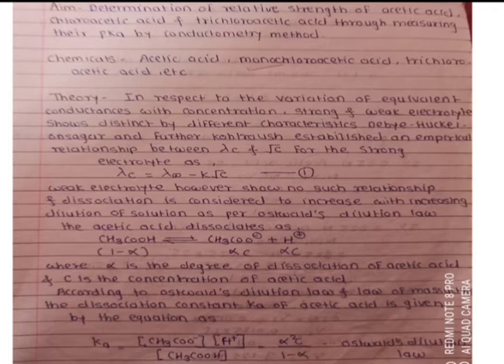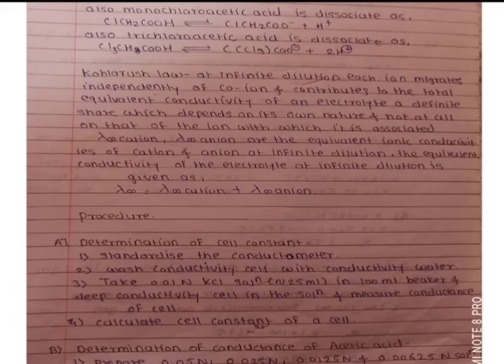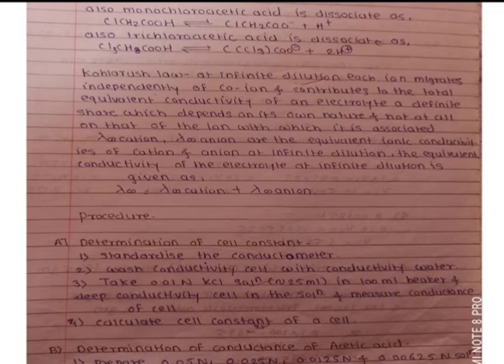Chemicals are acetic acid, monochloroacetic acid, and trichloroacetic acid — you can remove trichloroacetic acid for this year. You can note down the theory, meaning what is meant by alpha, dissociation constant, and the laws related to conductometry. Note down the theory relevant to your experiment, and then write the procedure as already described.